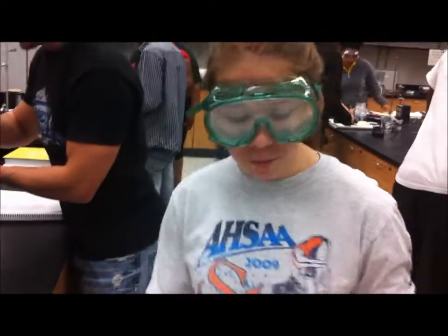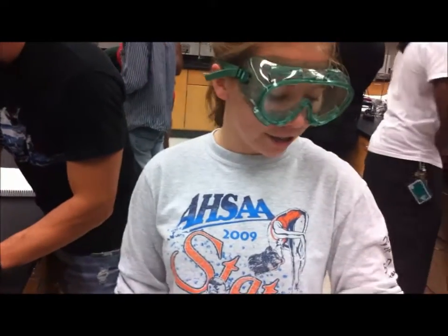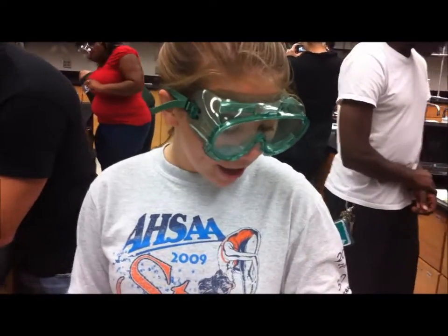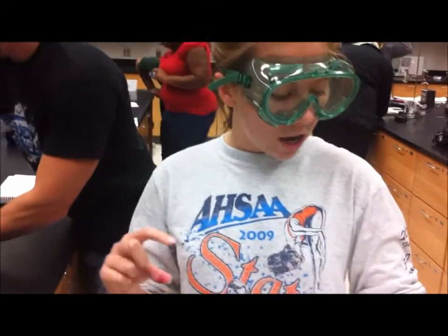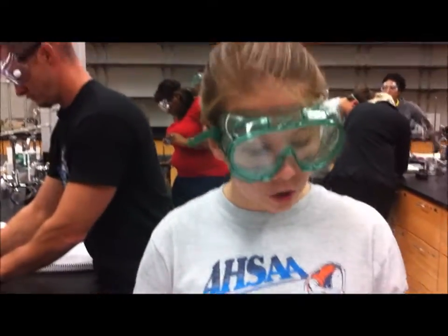Alright, we're performing a chromatography today, and it's the most widely used analytical process. It's used to separate and ID components of a dye. And the process in which a chemical mixture carried by a liquid or gas is separated into components is a result of differential distribution of the solutes as they flow around or over the stationary liquid or solid phase.